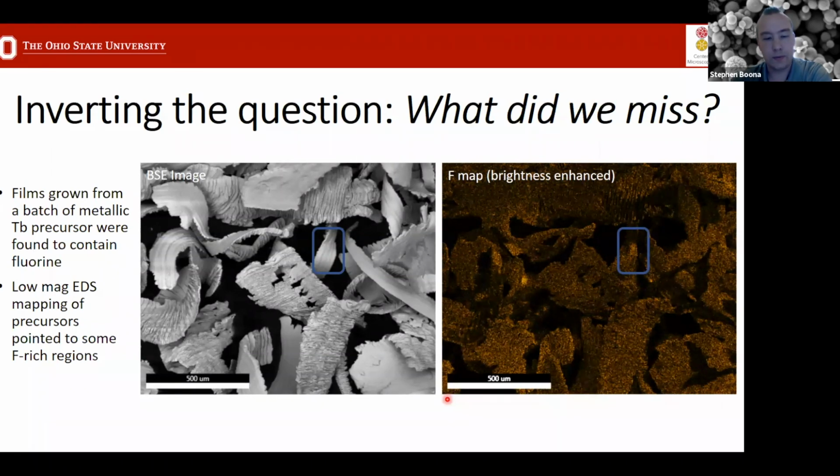So in this case, we're doing the opposite. You don't necessarily know where the element is concentrated. And if you look at the spectrum from this whole area, if there is any fluorine present, it's going to be such a small amount you probably wouldn't see it, and the auto ID wouldn't find it. But you can add it yourself and then look at the element map and see if any spots light up, since each pixel has its own spectrum. So in this case, there was a spot that looked like maybe there was some extra intensity.